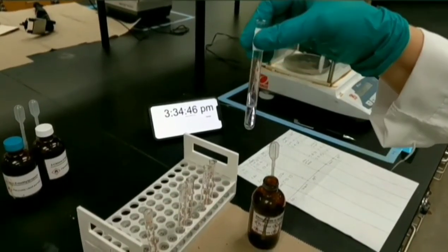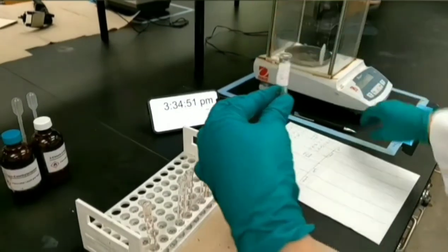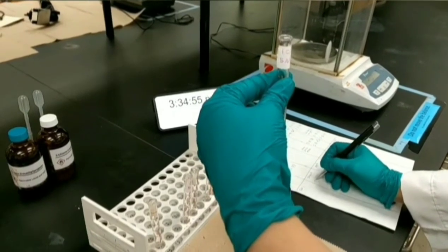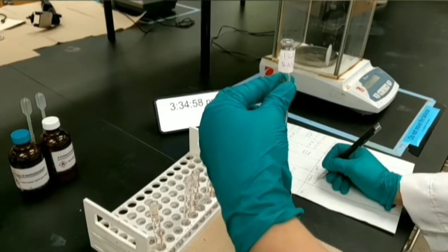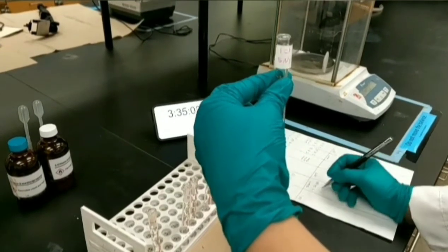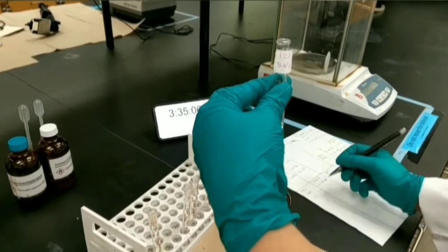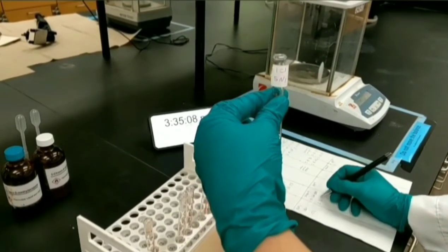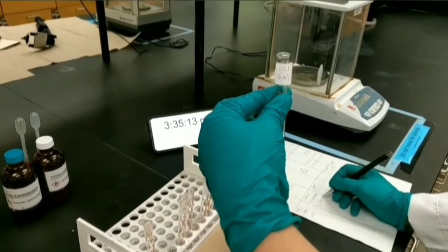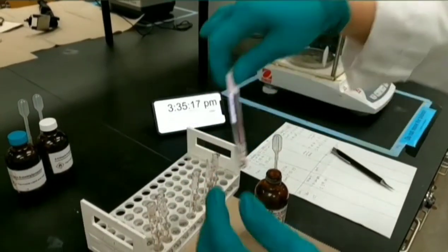The substrates which can make better and more stable carbocation can react better through SN1 reaction. Secondary alkyl halide reacts better than primary, and tertiary alkyl halide reacts better than secondary because they can make a more stable carbocation respectively. Because there is no immediate reaction, I can put this test tube in the rack and I can check it later again.